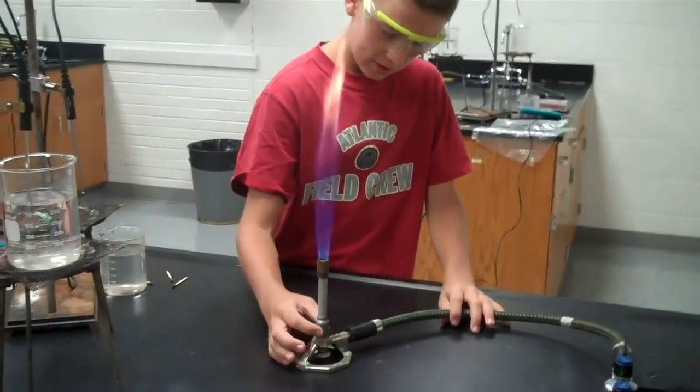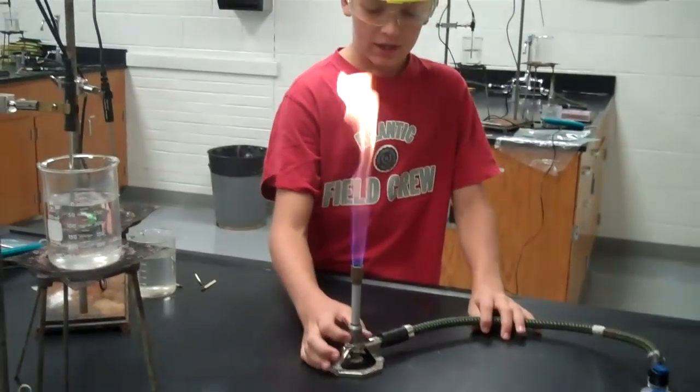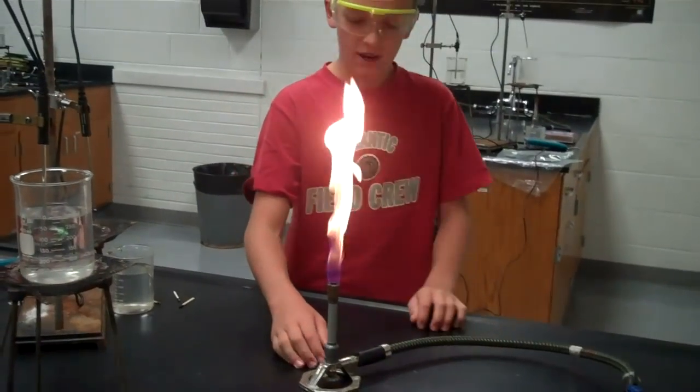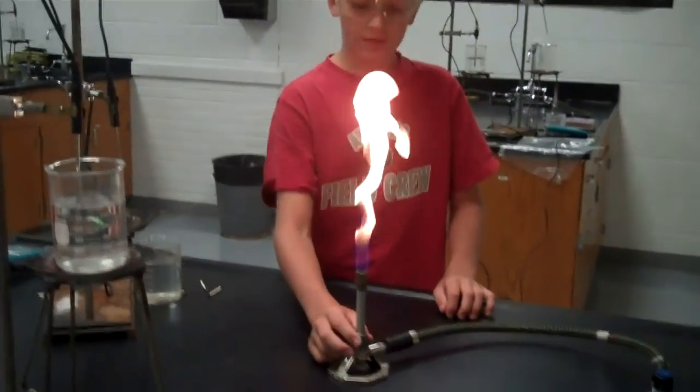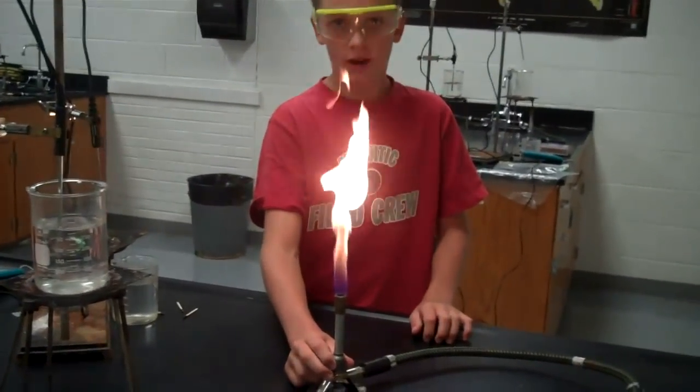it goes to an orange flame. The reason it's an orange flame is because there's less air getting to the gas. And the blue flame is more air getting to the gas.